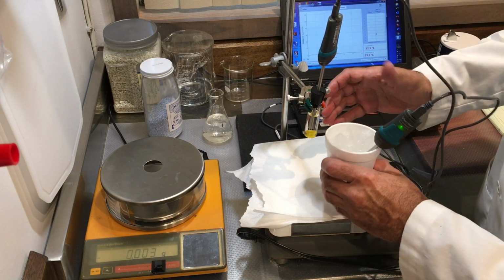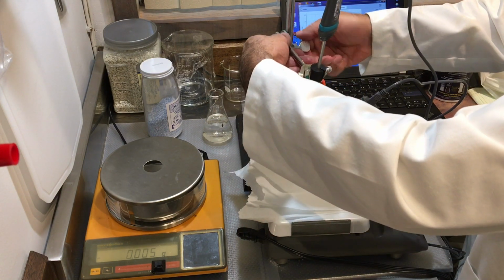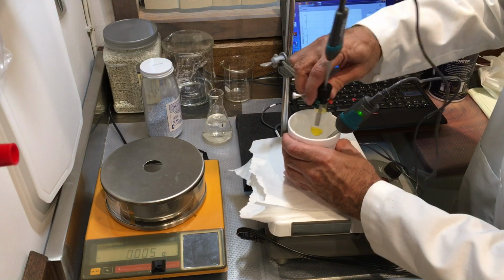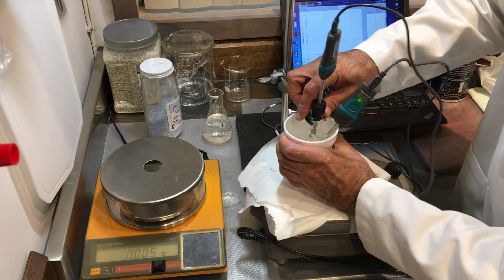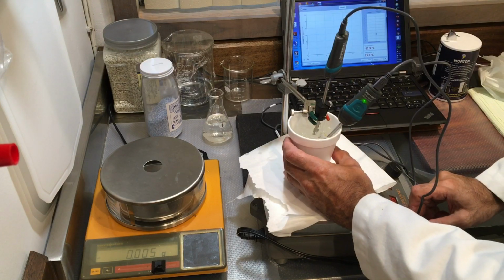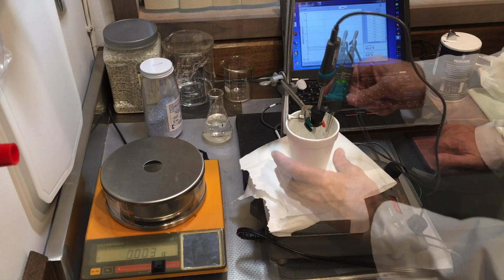So it's going to actually be lower than that. And I'm going to increase the height, put this in. I have some big piece of ice in there which fell, I think, which is good. And the temperature of the bath is -11, which is pretty good.